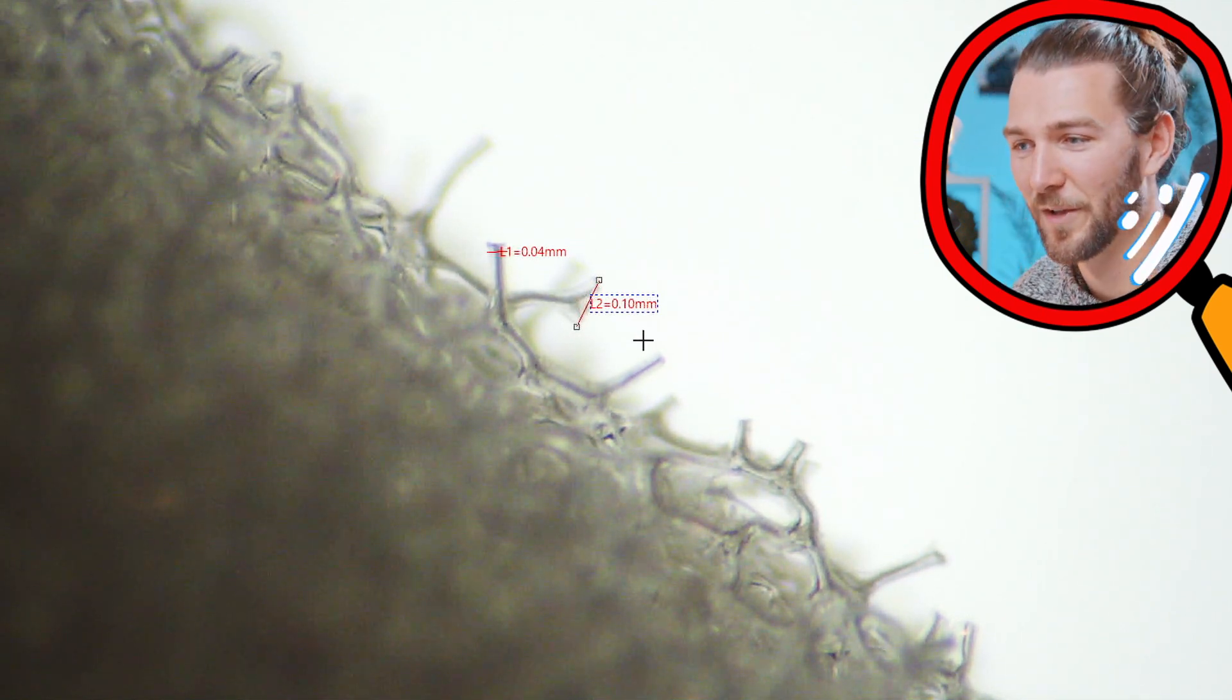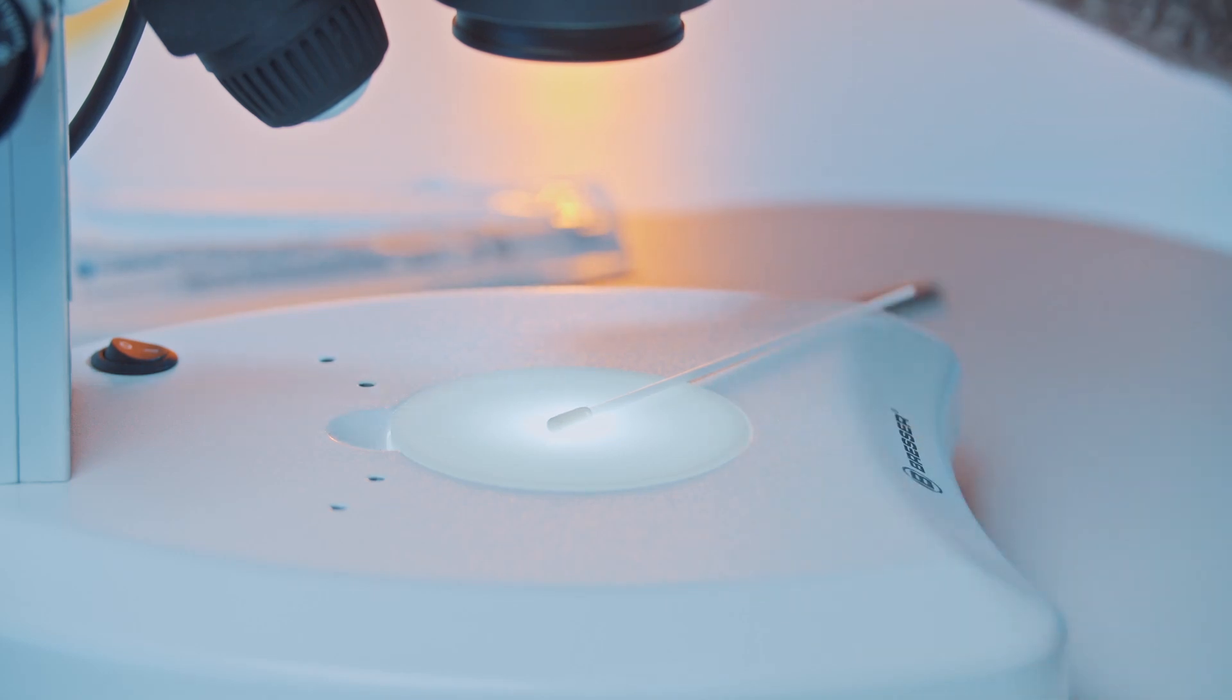One thing is left to be done is to see how it reacts when I use my tool to wipe over it. Move over here, up and down. This sponge is super soft. You can see how it goes in and out here. If I poke it, it goes really, super soft. It goes in but doesn't seem like it detaches. I think it's safe to use.